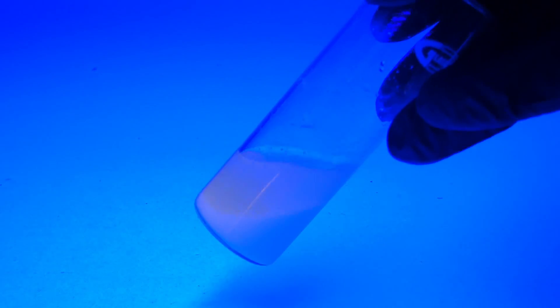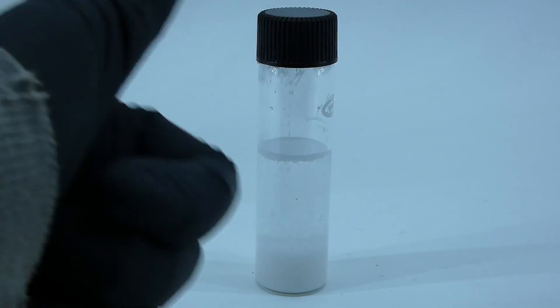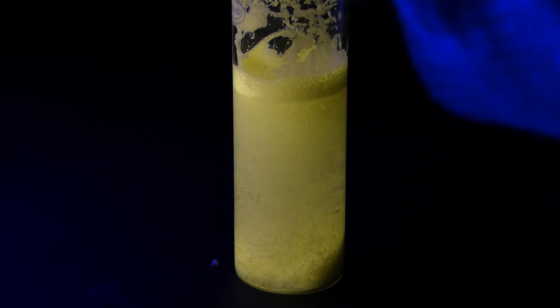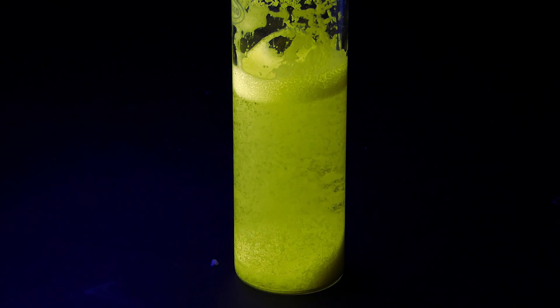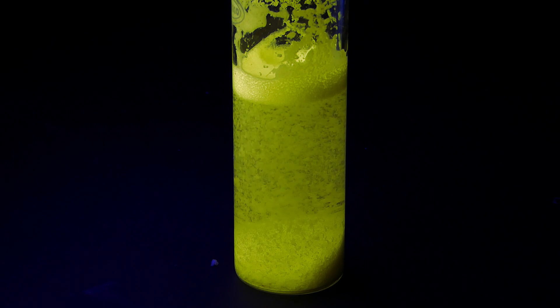After all of this careful preparation, I was finally able to make some more of the yellow complex. I sealed it in a vial, and I gotta say that it looks quite nice under UV light. It could glow brighter if I had a different frequency light source that is not overwhelmingly violet, but I didn't want to spend a fortune on it, so this one has to do.